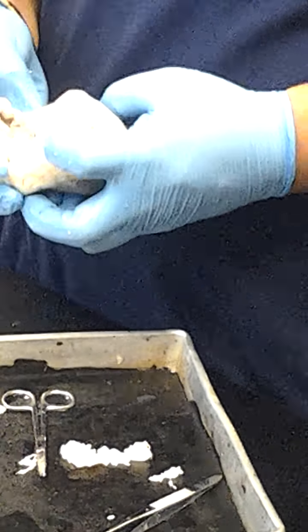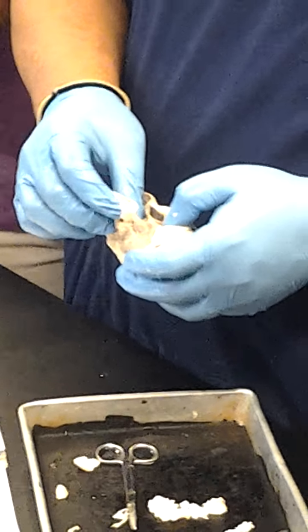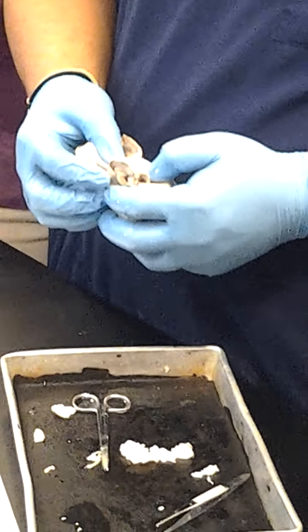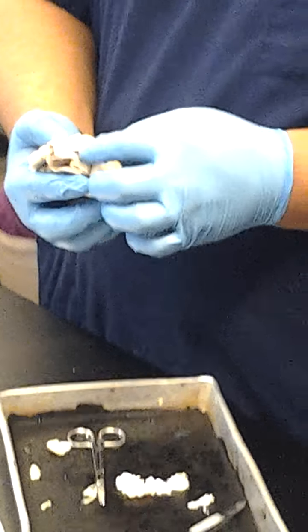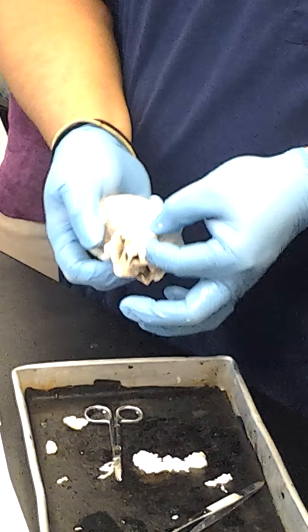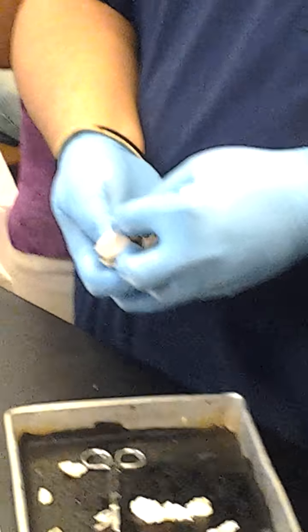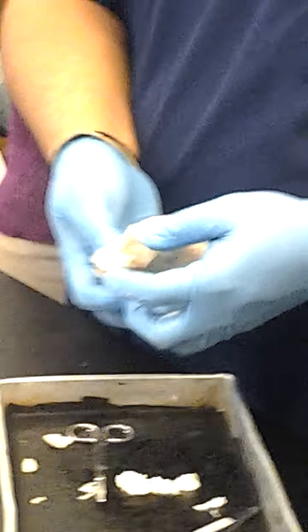Then on this side, where the left auricle is, we have a larger hole over here, which is where the pulmonary veins would have been. Now, over here, we have these two large structures. We have this one in the front, which would have been the pulmonary trunk, and this one in the back, which is the aorta, and of course a branch coming off of the aorta, which is the brachiocephalic.